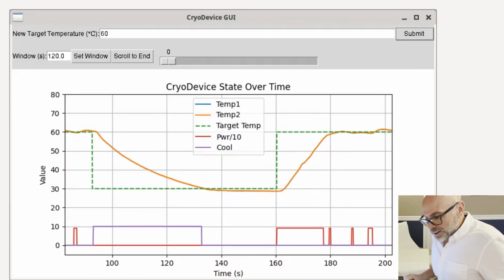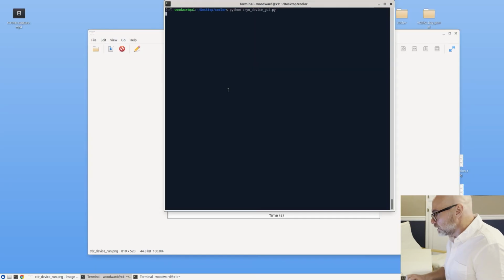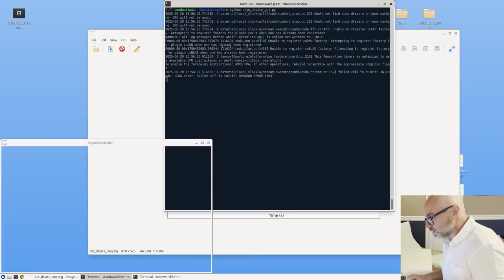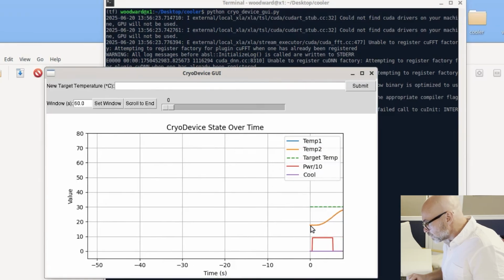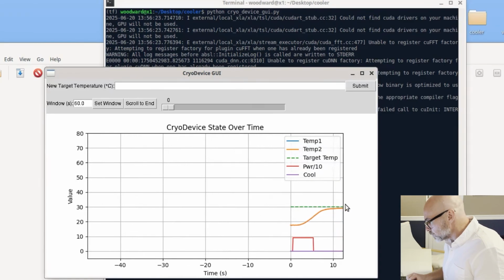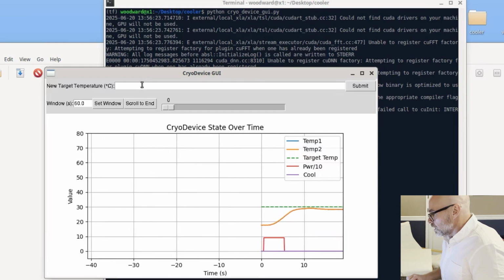Okay, so let's look at it now, which is kind of cool. So we'll run this guy. Let me make sure the liquid level is good. Yes. Okay. So, all right, launching. So it started at under 20 degrees Celsius, and then the first initial commanded position was 30 degrees Celsius. So it's roughly holding it, certainly within my tolerance of 5 degrees.